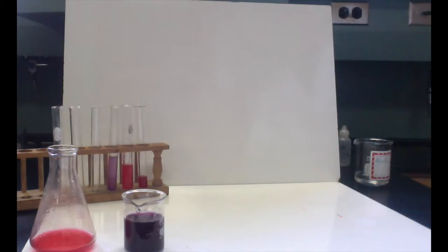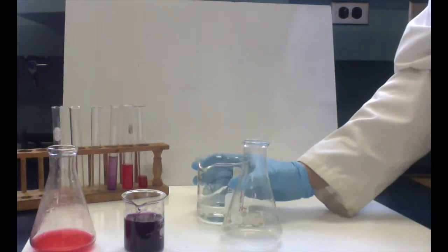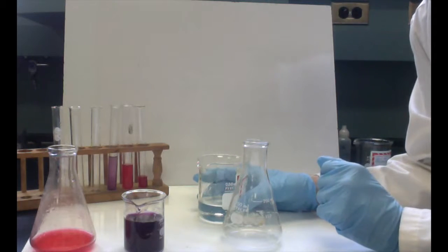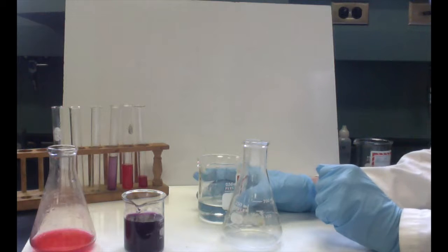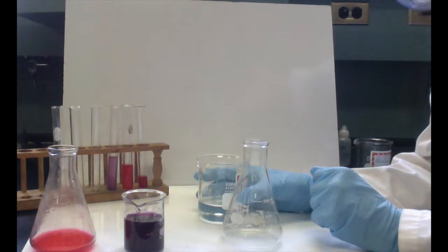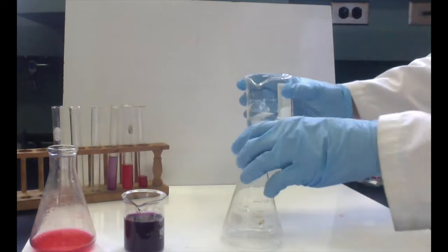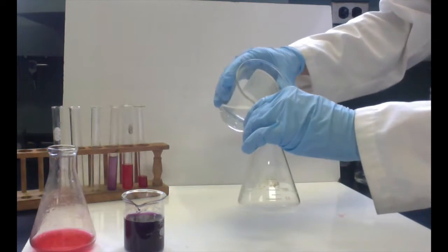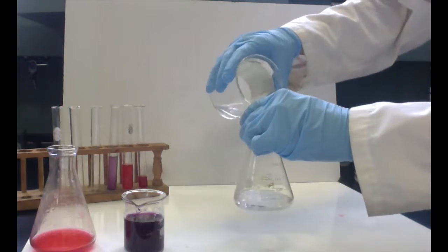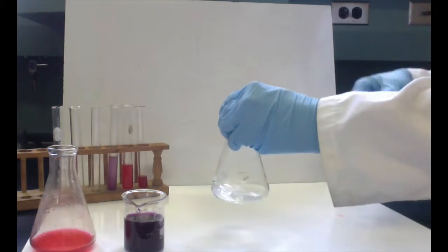Now let's do the opposite end of the spectrum and see what we get with a little sodium hydroxide. Sodium hydroxide is NaOH. That's sodium, Na, and OH, which is hydroxide. The OH part of it, hydroxide, will attract H pluses and cause them to react and make more water, which is going to decrease the amount of H pluses or protons in the water. So it makes it less acidic. On the other hand, it makes it more basic, which is equally corrosive as acids can be.